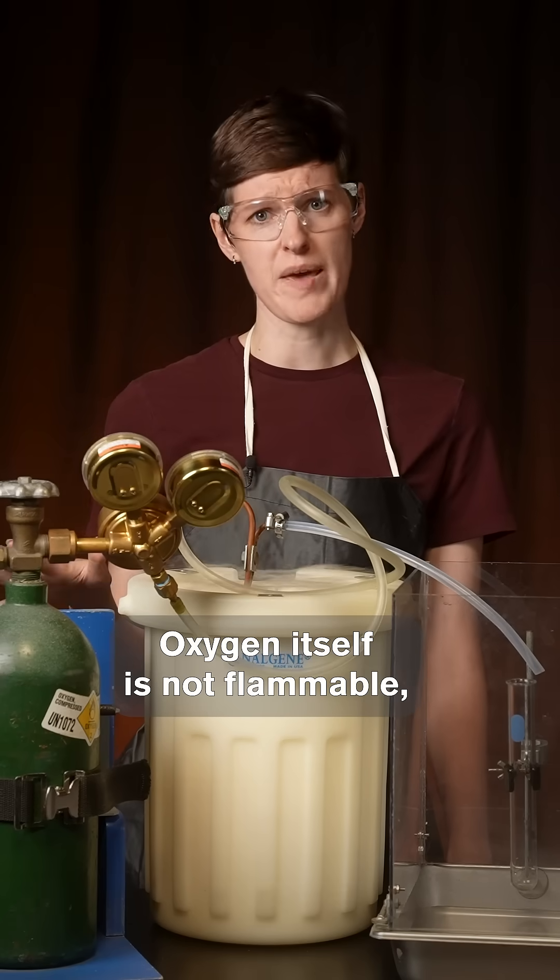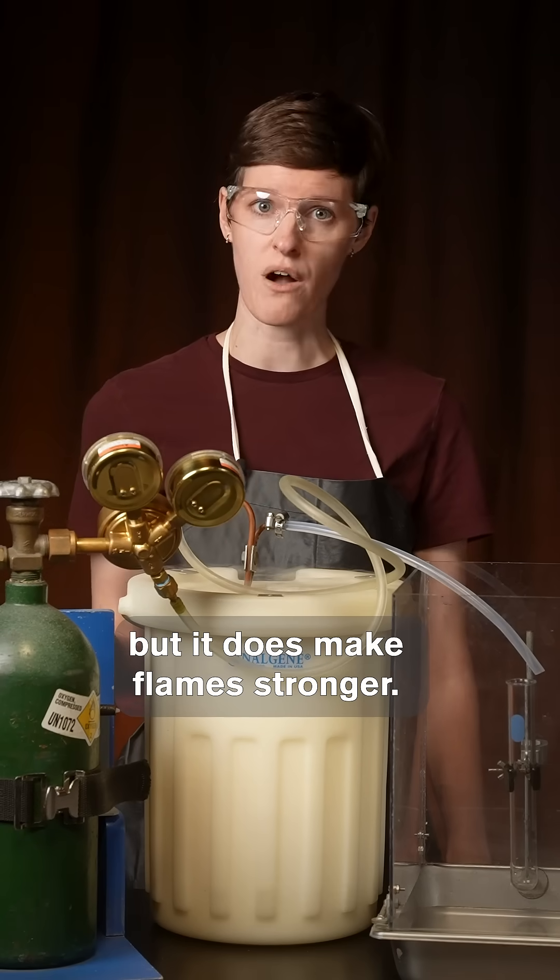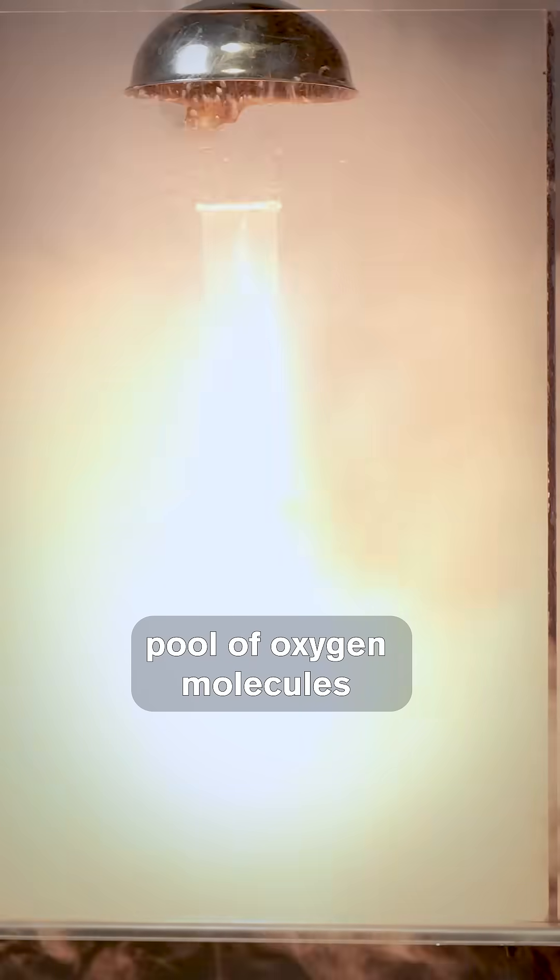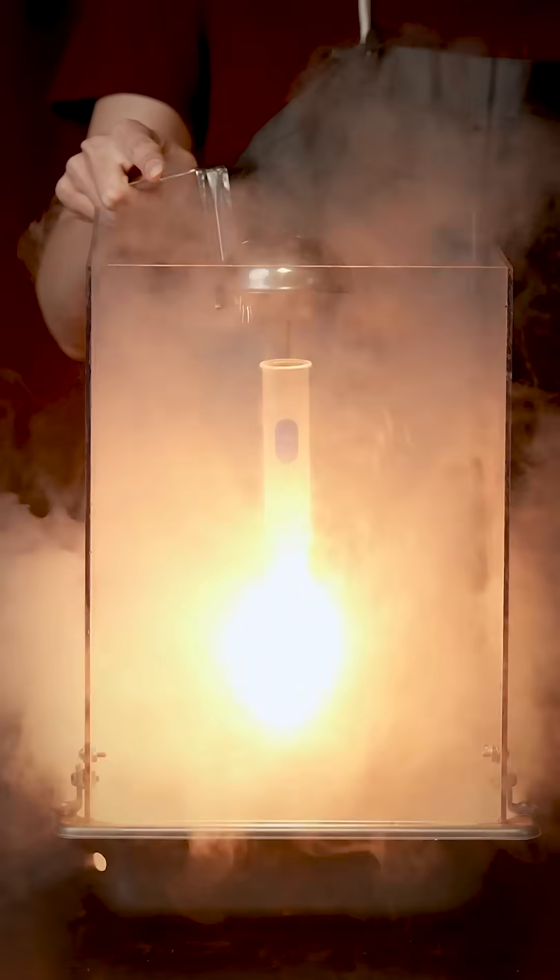Oxygen itself is not flammable, but it does make flames stronger. So when we drop an ember into the concentrated pool of oxygen molecules in the test tube, it ignites.